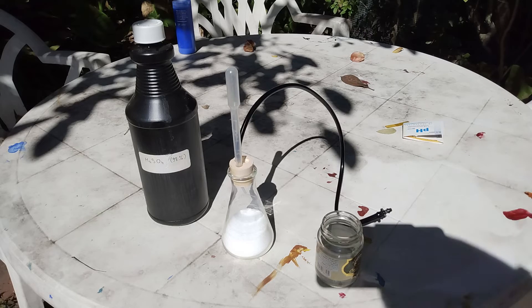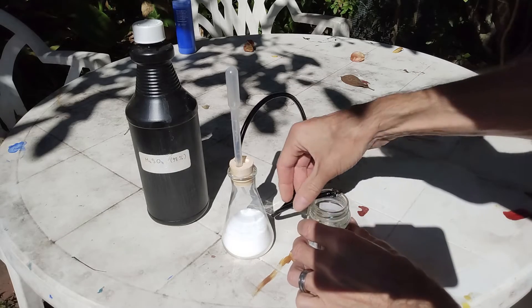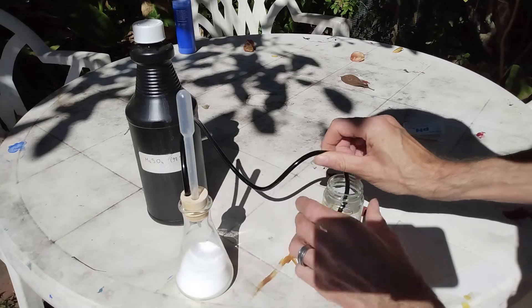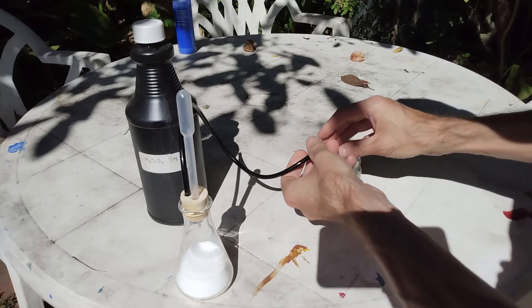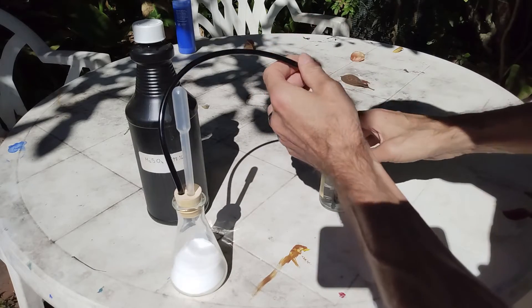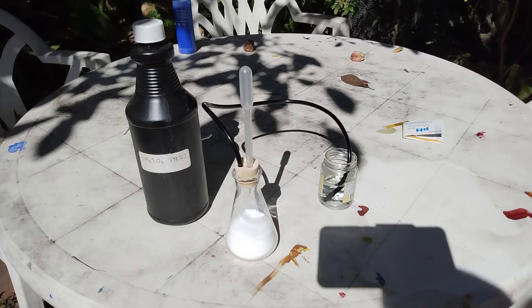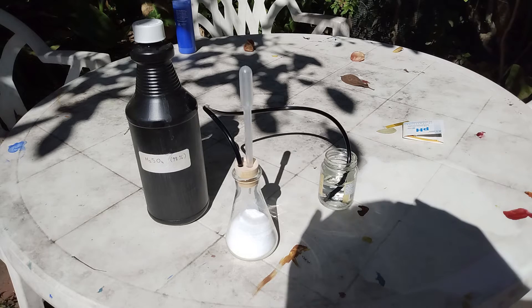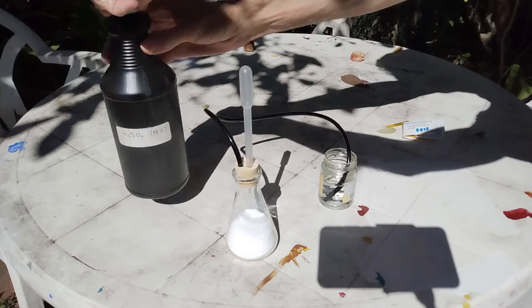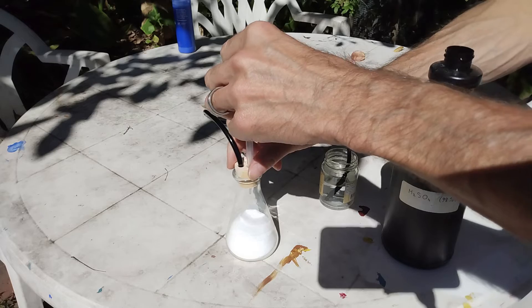So now we are going to put this hose into the water. Let's add some sulfuric acid — sorry, some sulfuric acid. So let's take this pipette.